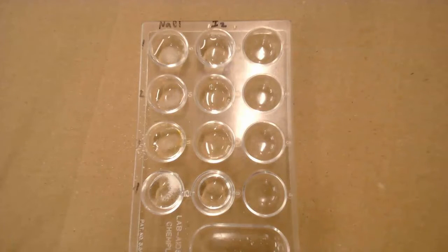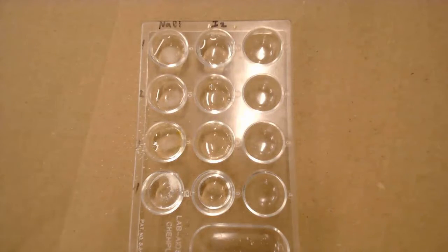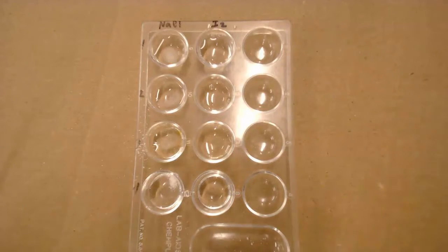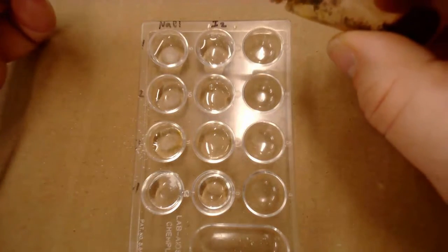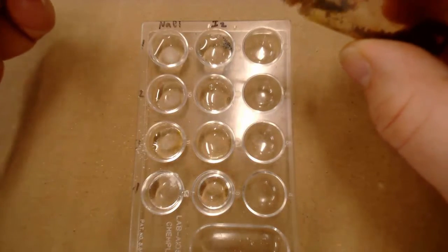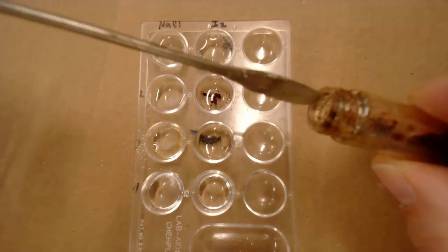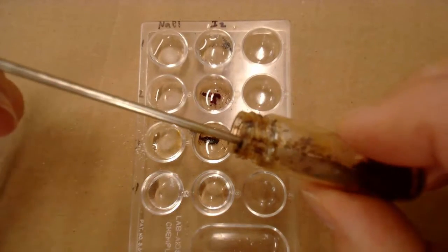On the other side, we are going to put a small amount of iodine. This is iodine, I2, which is a nonpolar substance. I only want to use a little tiny bit of this because it's really tough to clean up. So I'm just going to add a little tiny bit of iodine into the water, into the mineral oil, into the corn oil, and into the glycerin.